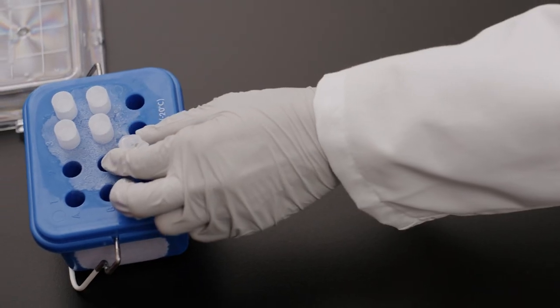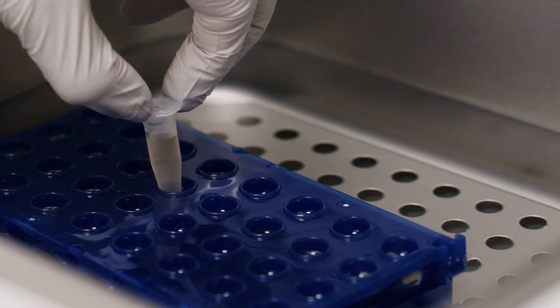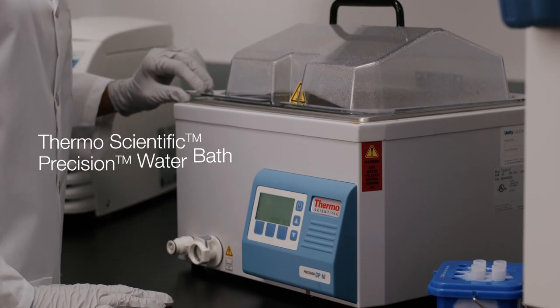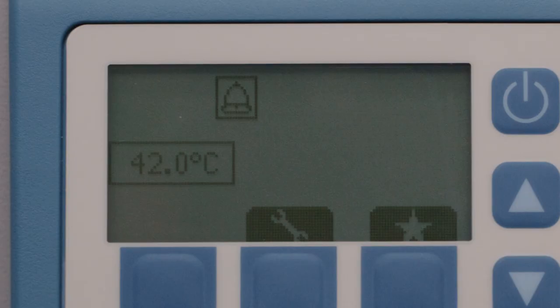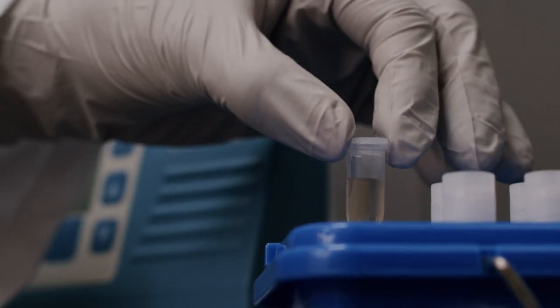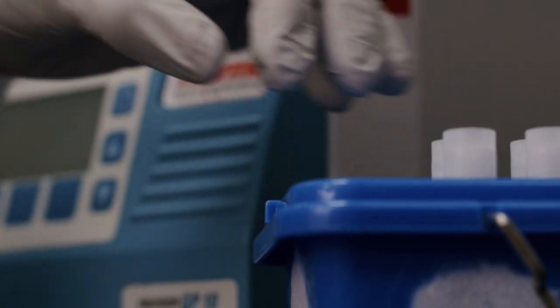See how Maria places the tube on ice? Once cold, she heat shocks the mixture in a ThermoScientific Precision water bath for 30 seconds. This takes place at 42 degrees Celsius and is followed by another two minutes in the ThermoScientific benchtop cooler.